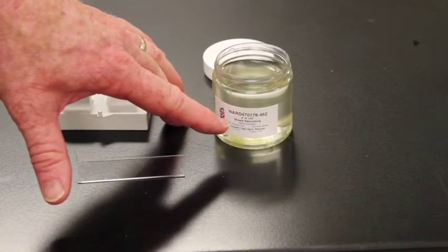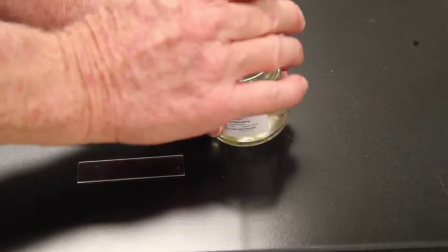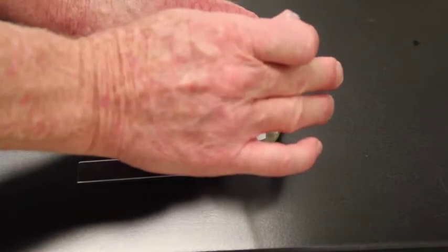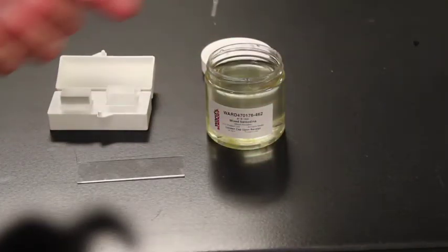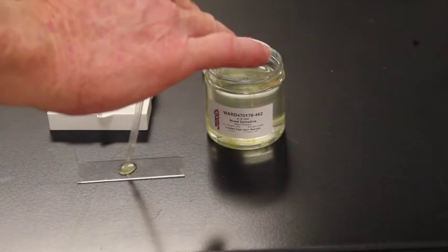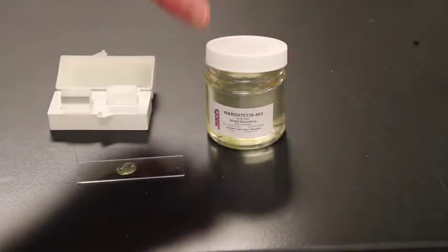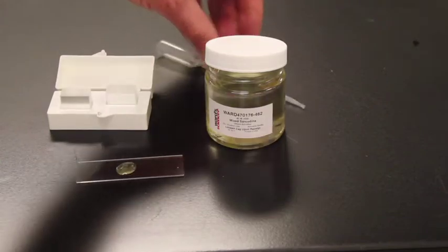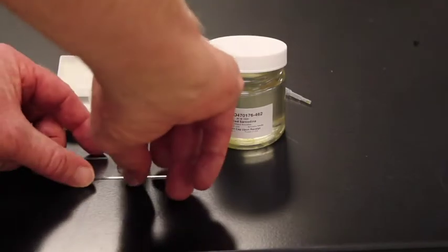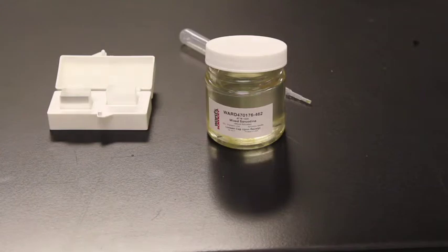They're heterotrophic, so they're feeding on all of the debris. So what I want to do is make sure that I go down into the bottom here and gently suck up all the debris I possibly can. So you can see all that debris in there. And then take this, put drops on here. Okay, we'll close this lid off. We'll leave it a little bit open because these actually have to have air, so we don't want to close it completely. And I will go in and place a cover slip on the slide and prepare it and have it all ready to go.